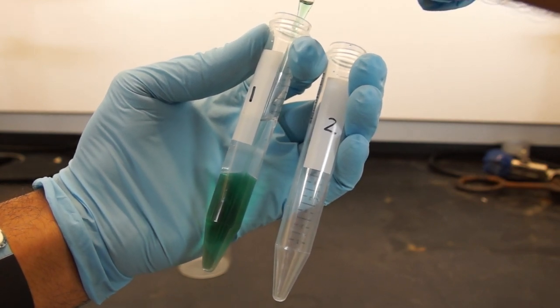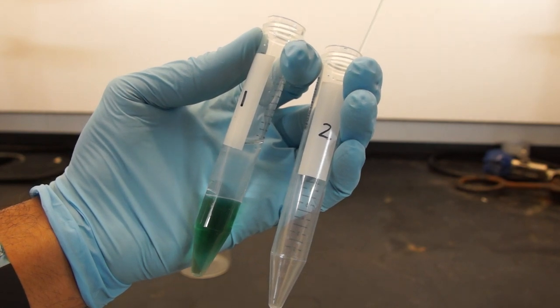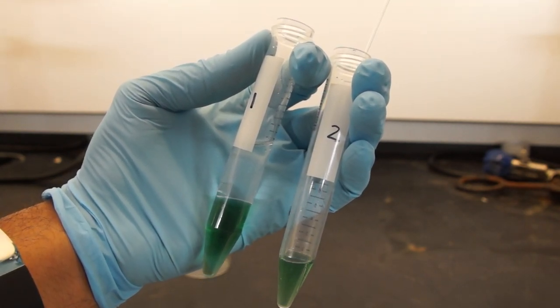You only want to draw up the bottom layer and transfer it to the new falcon tube.